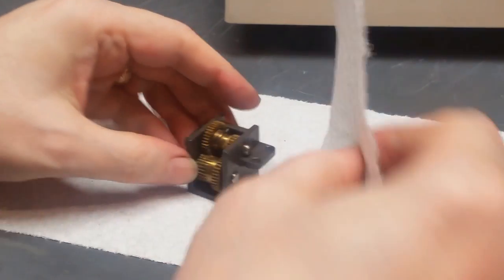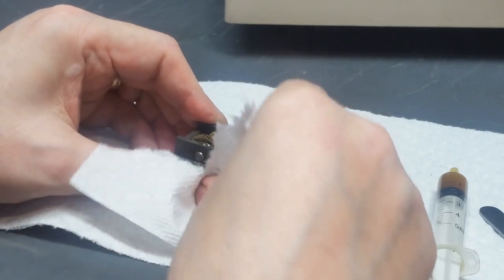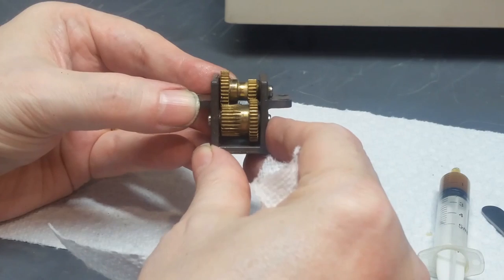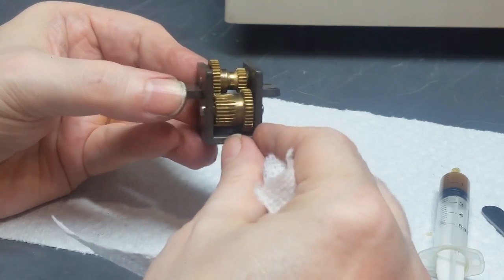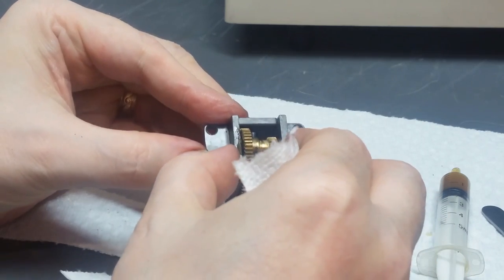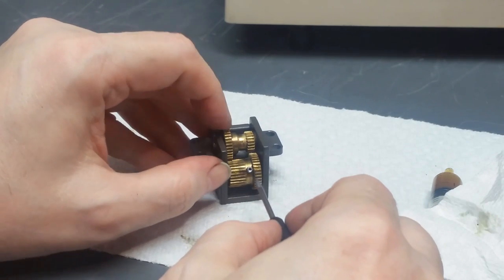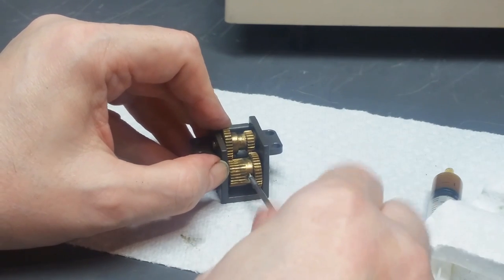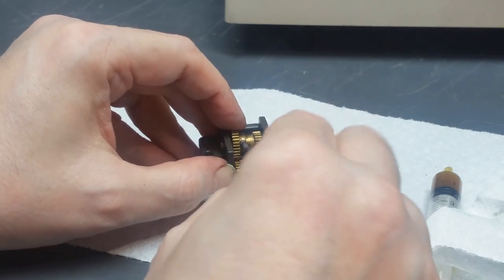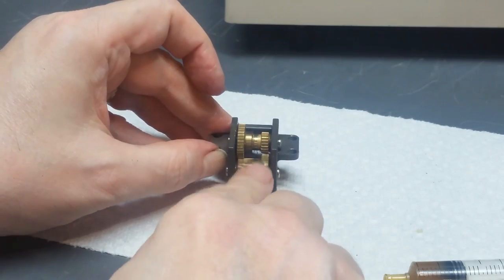Now let's do a little cleanup here. Wipe away the excess grease on both sides of the housing. Now, if you look at it from the front, you want to make sure you have roughly the same amount of shaft protruding on both sides. That's close. Then we take our 1.3 millimeter hex tool and tighten down these set screws so that the gears are stationary and clamped to the shaft. Okay, now this baby rotates free like it's supposed to.